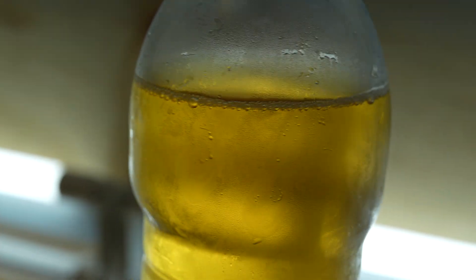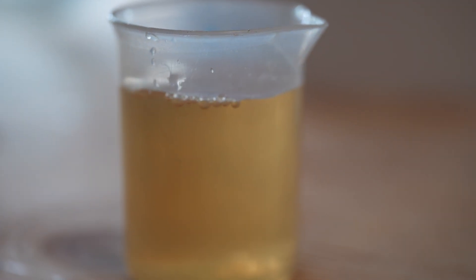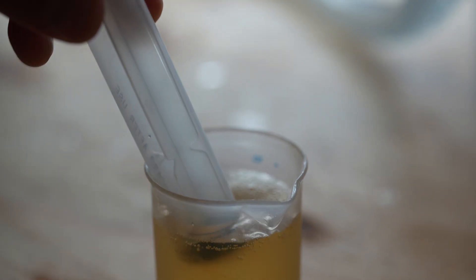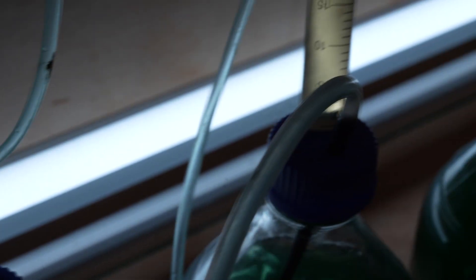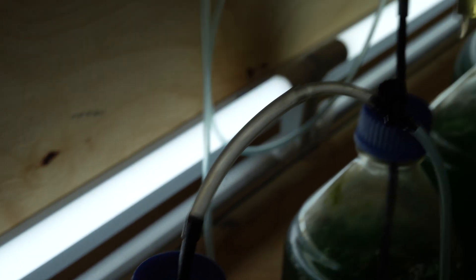It comes as a nutrient powder and we mix it with RO water, which is reverse osmosis water. It's very pure fresh water. And then from there, once it's mixed in RO water, it basically turns into a nutrient liquid. So it's filled with your NPKs, basically like nitrogen, phosphorus, potassium, your nutrients that your plants need to grow. So it's very high in those nutrients. And then what we do is we use that as a food for your phytoplankton.